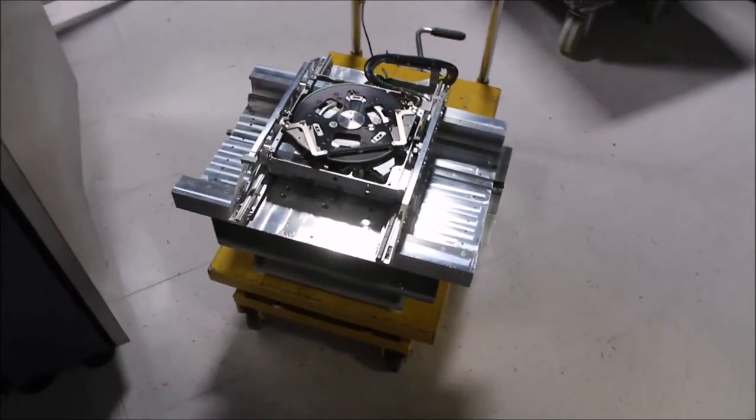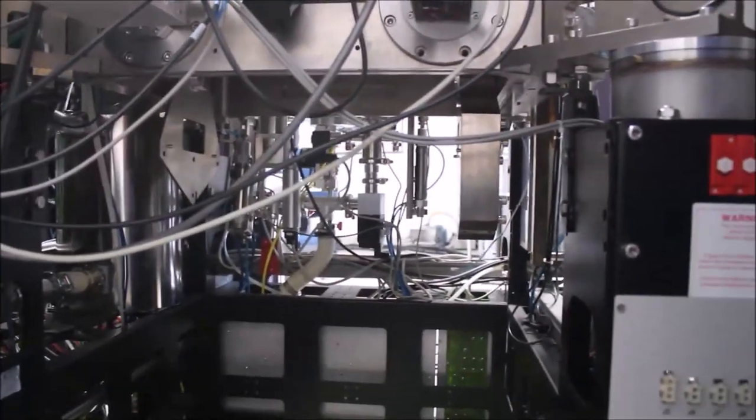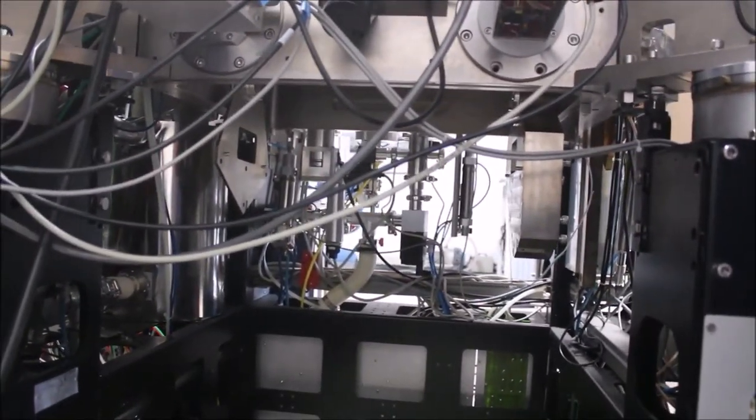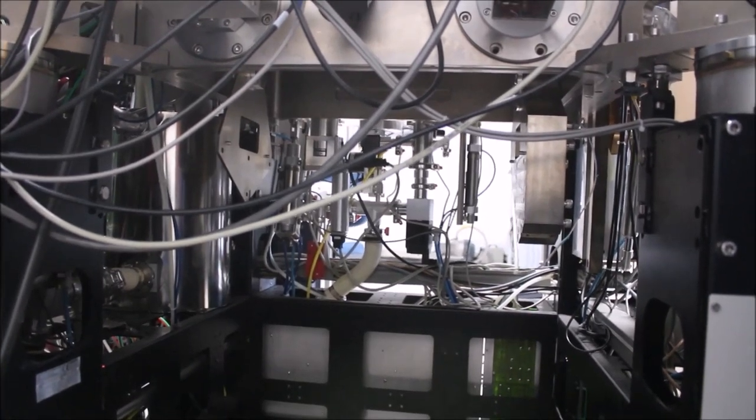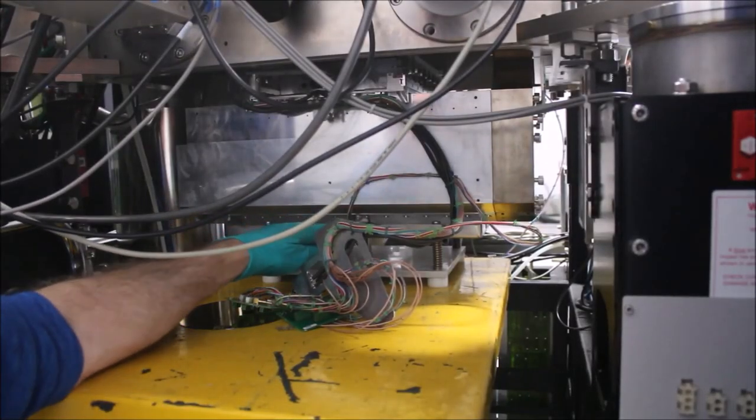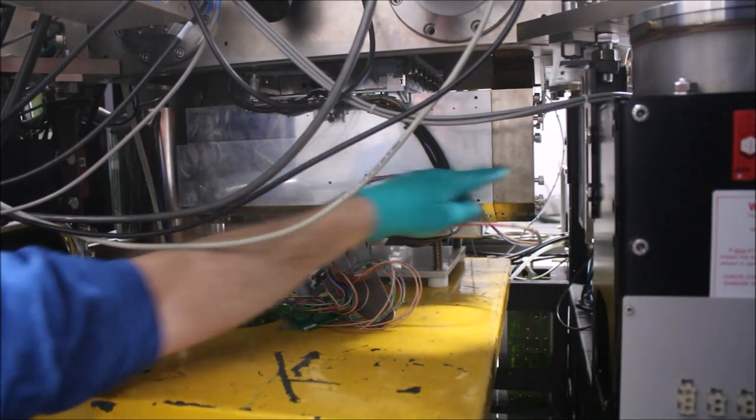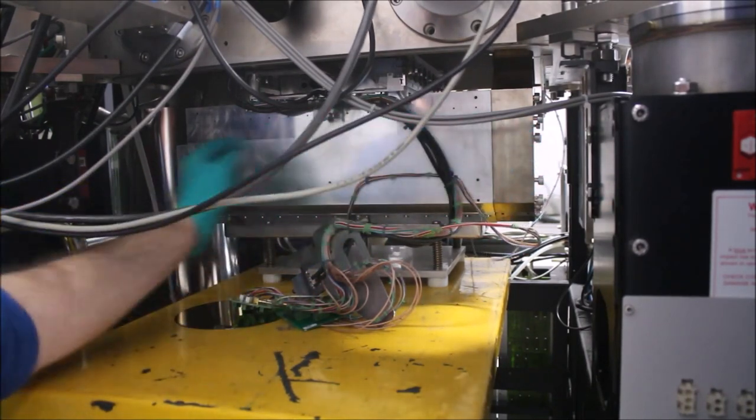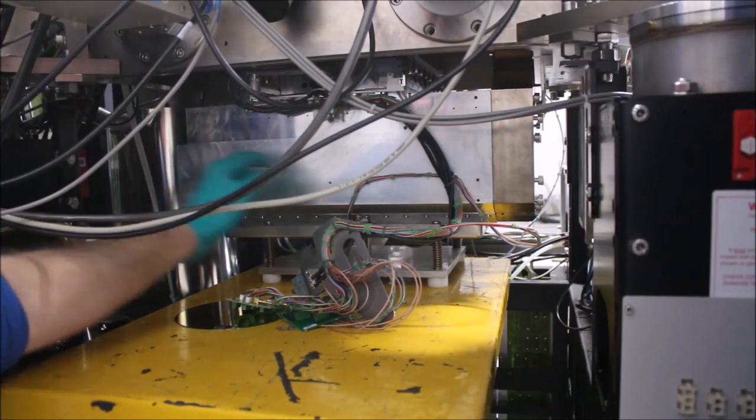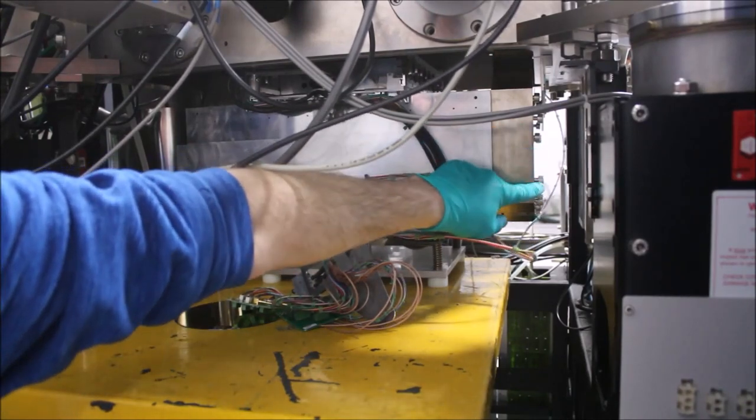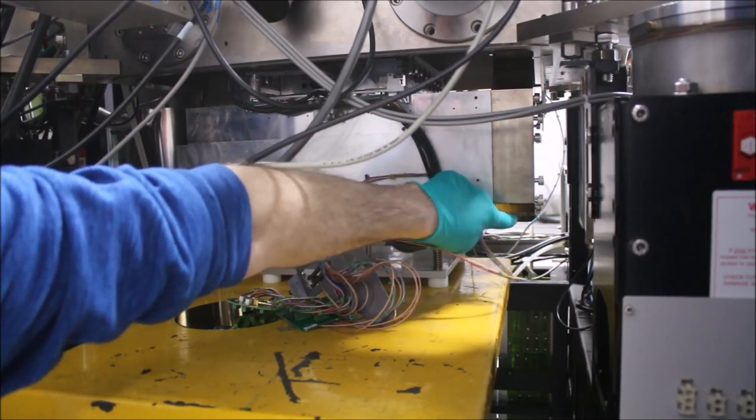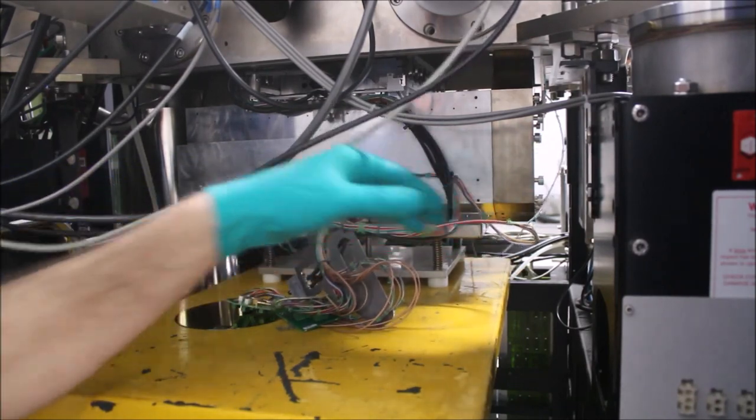Here's the stage on the little lift. We've cleared away a path so we can get it back under the chamber. We need to get it in between the counterweight and the bracket that hold it in place. We've got the stage in place. We've got the little red indicator showing that we have enough pressure. Now we've got to tighten up all these bolts on both sides with four bolts on the one bracket side and the socket head bolts on the counterweight side. Then we can connect the electronics.